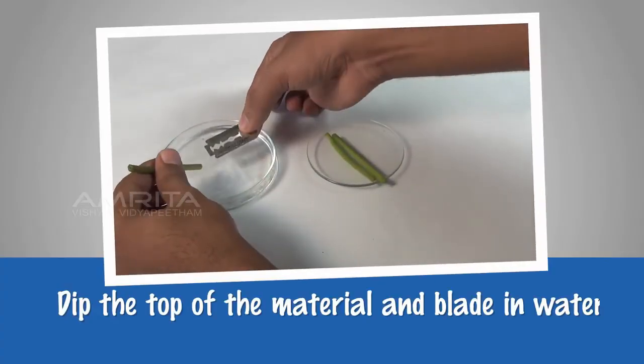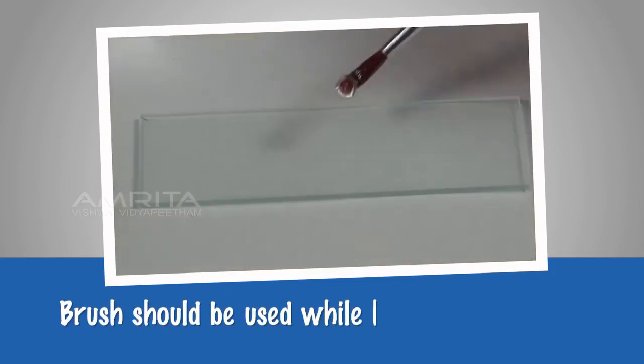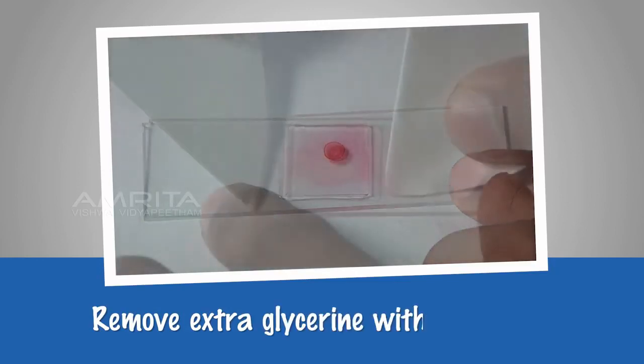Precautions. Dip the top of the material and blade in water before cutting the section. Brush should be used while handling the section. Remove extra glycerine with filter paper.